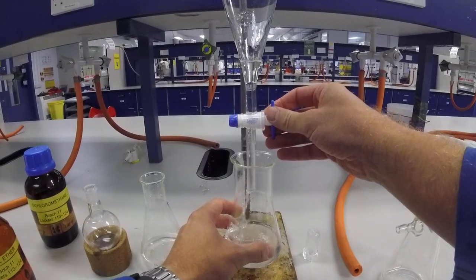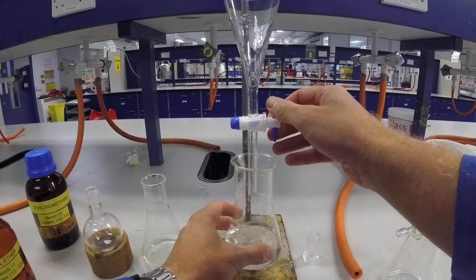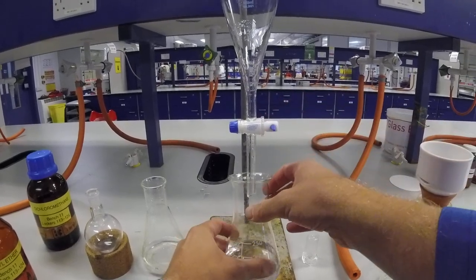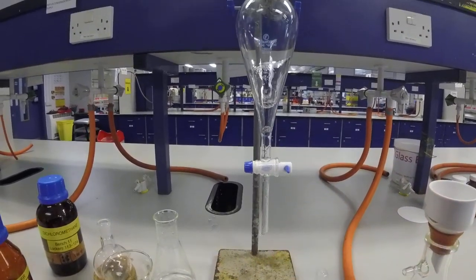So we've combined those layers. So we've got the combined organic layers. And there we go. And that is a liquid-liquid separation.